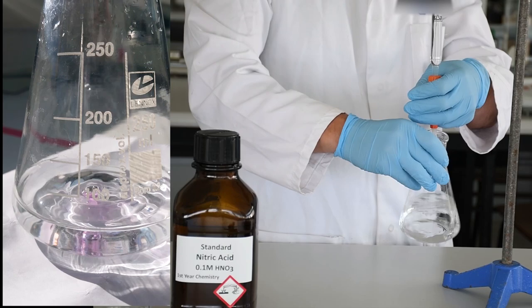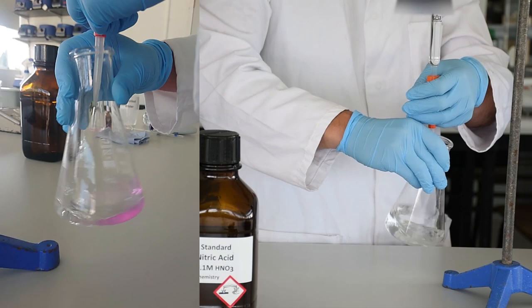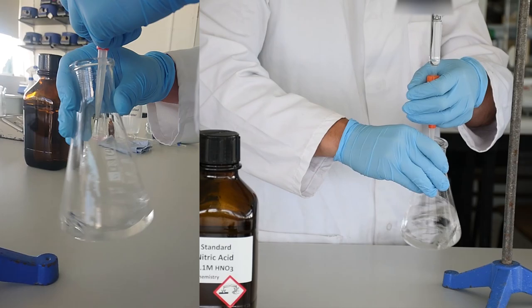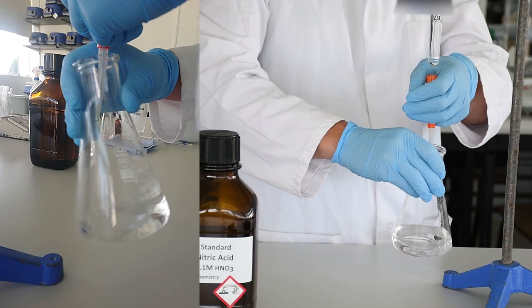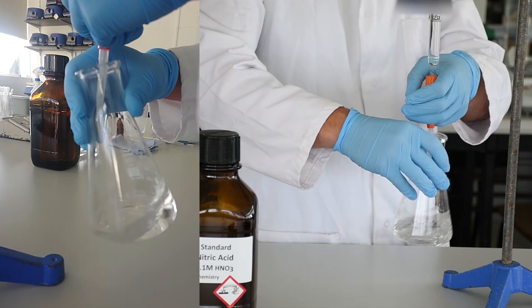When you finally get to the end of your titration and you've done it single drop by single drop, you need to double check that all of the material has reacted in your flask. The way we do that is by washing down the sides of the flask with some distilled water. It doesn't really matter if we add a little bit more distilled water because it isn't going to add any more acid and base and won't affect our endpoint. We're just going to wash down the sides and make sure we haven't left any material up on the edges.